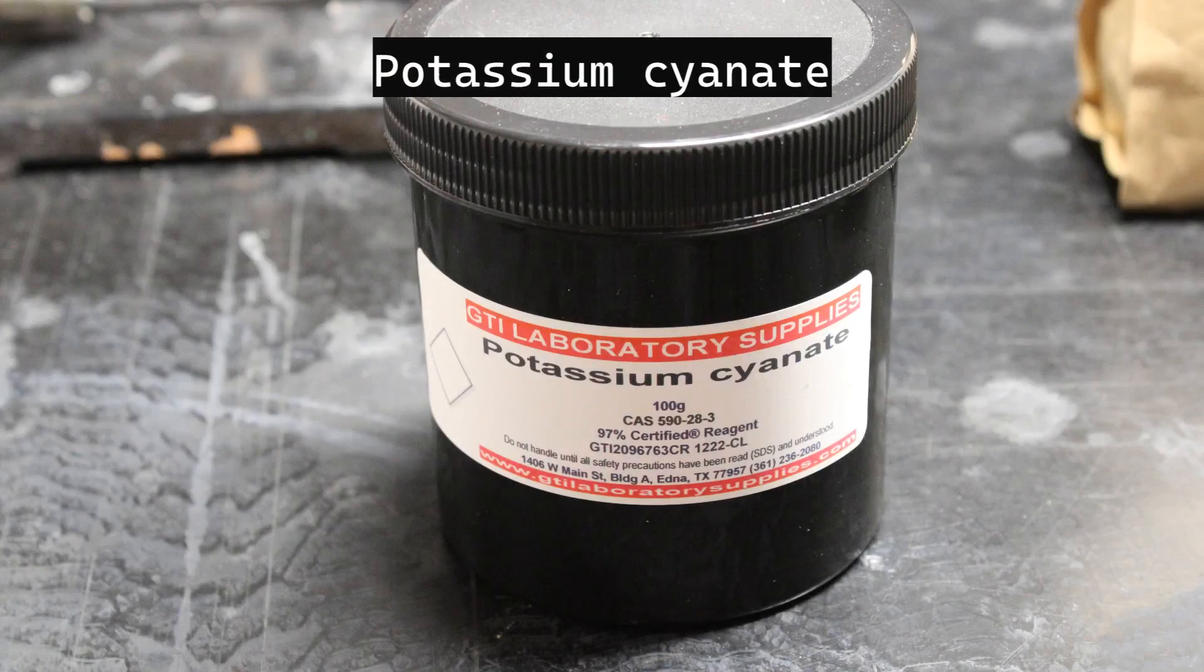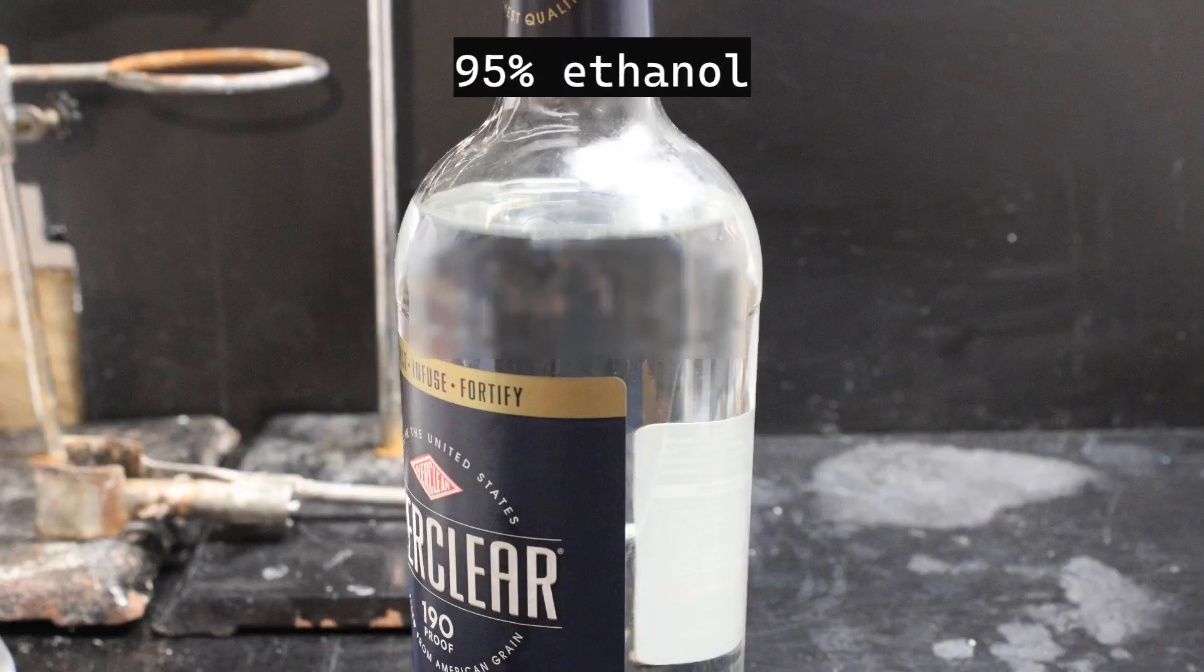For this experiment, you will need potassium cyanate, not cyanide, ammonium sulfate, isopropanol, and 95% ethanol.